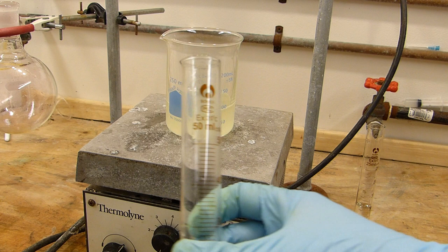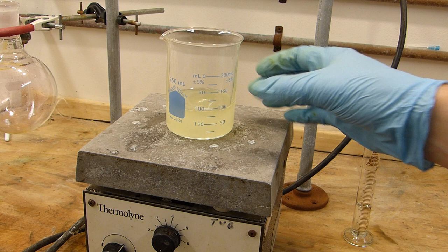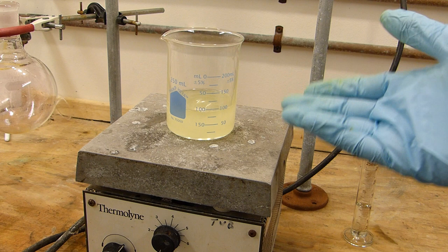And of course make sure you wash all of your acidic glassware. Don't leave this laying around because you may mistake it for water and have a bad mistake. And you see the yellowing color there of the hydroiodic acid formed and its subsequent decomposition into iodine.